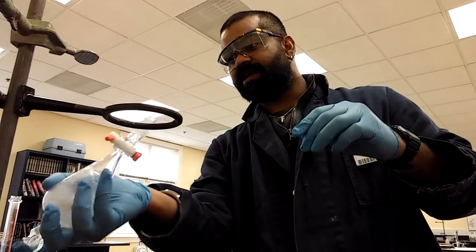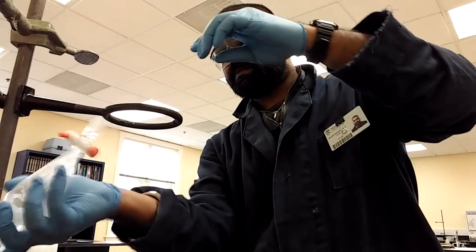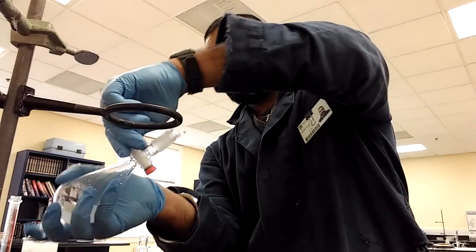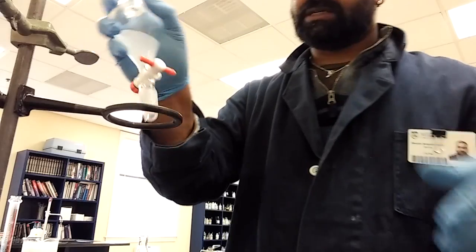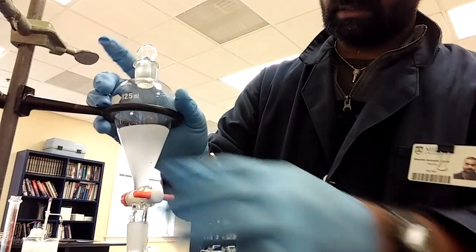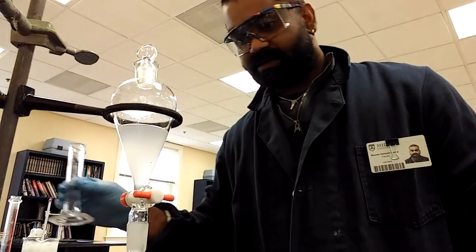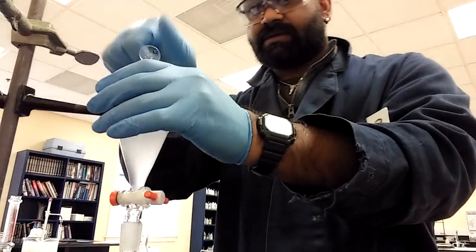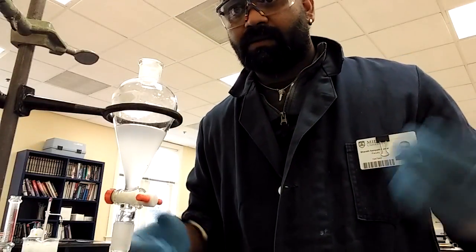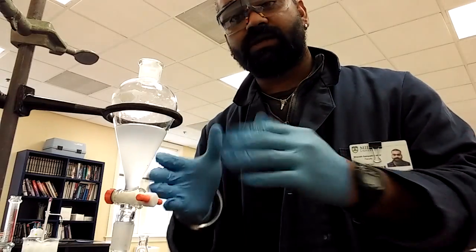I'm not just shaking it for a good long time. And that's it. So we're gonna seal it, put it back down. As you can see, it's not ideal. I would have some cleaning up to do after when I'm done here. So, well, I'm gonna stop here and I'm gonna continue doing this, and then I come back to you with what's happened. All right.